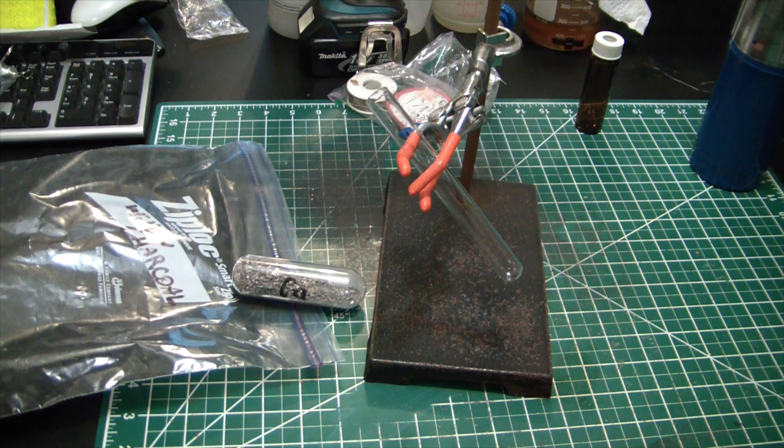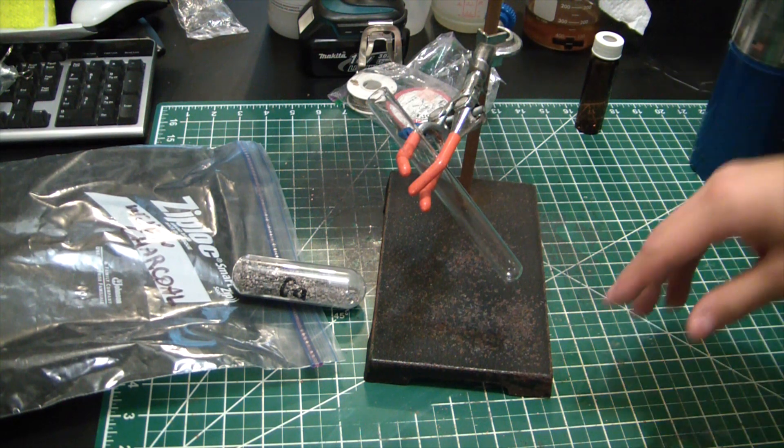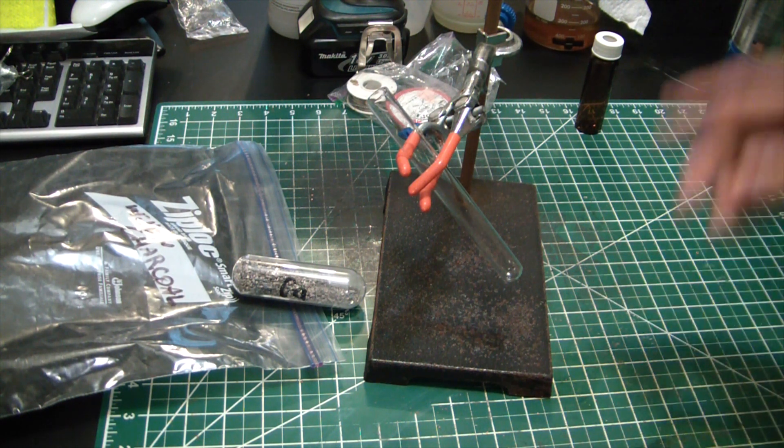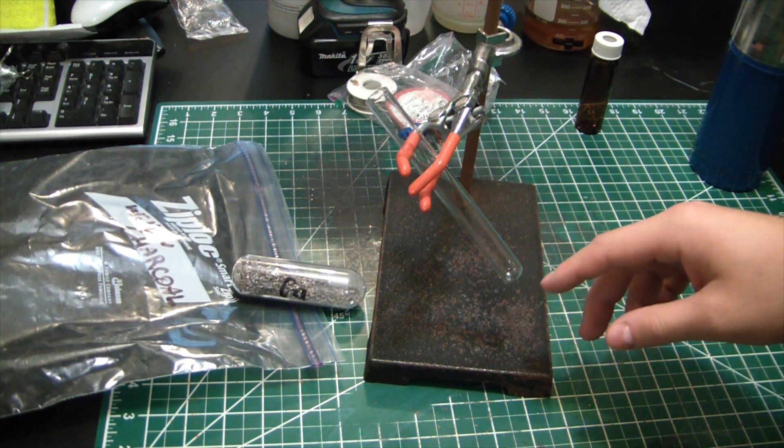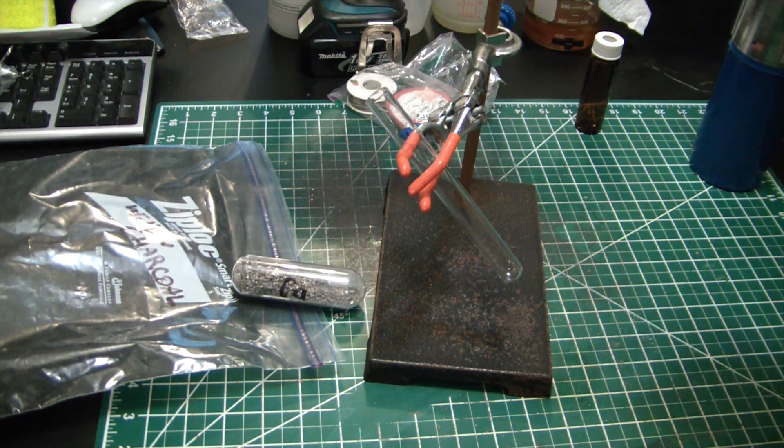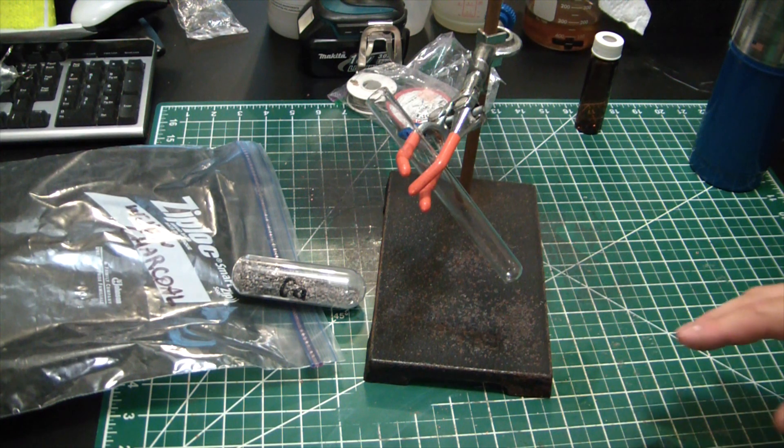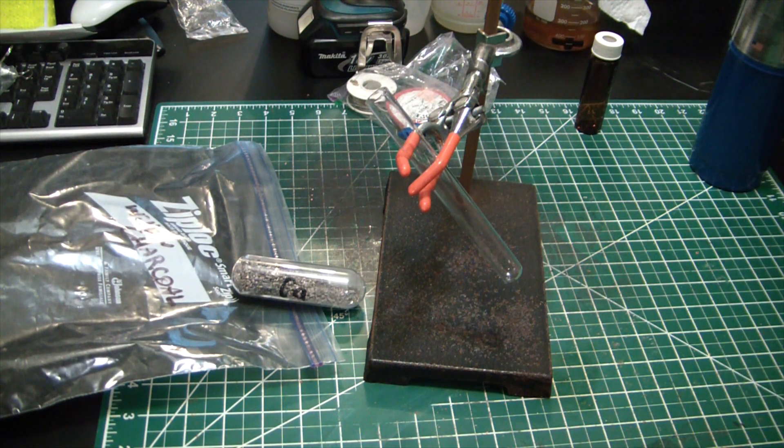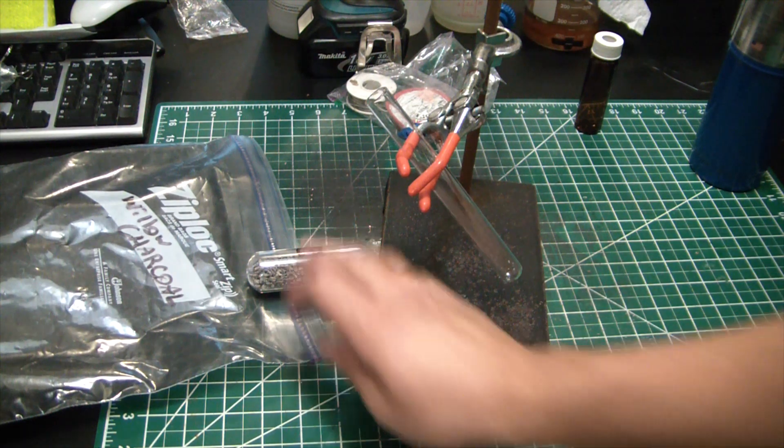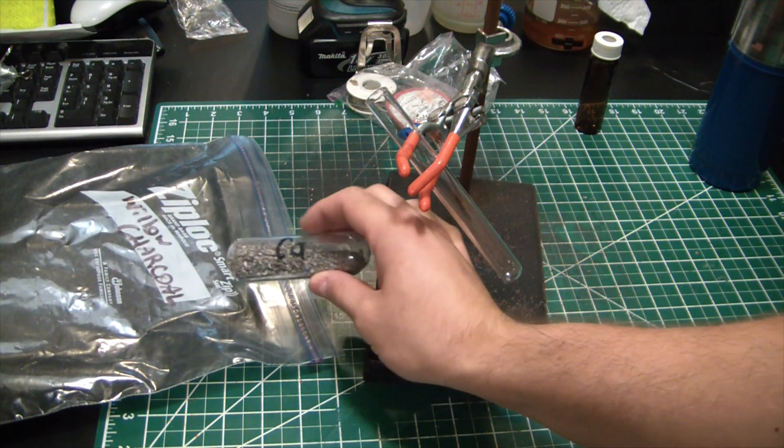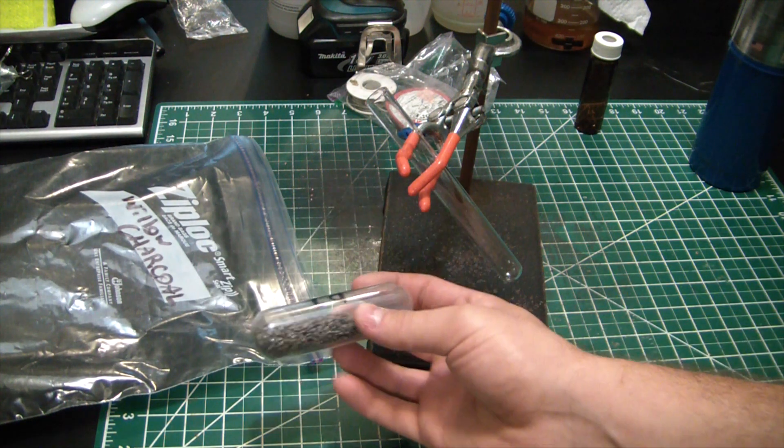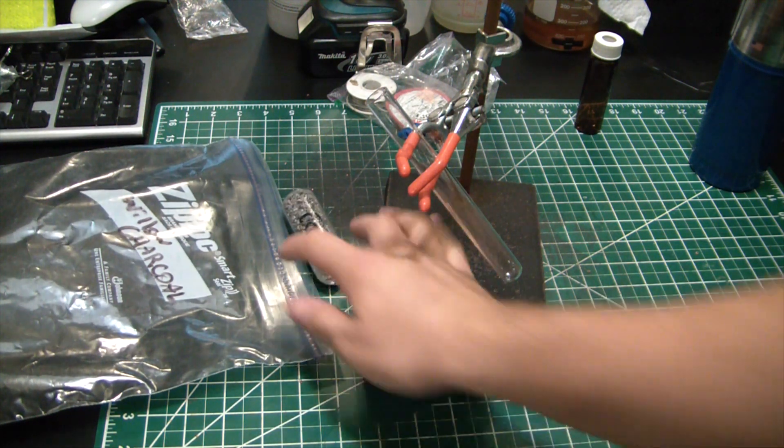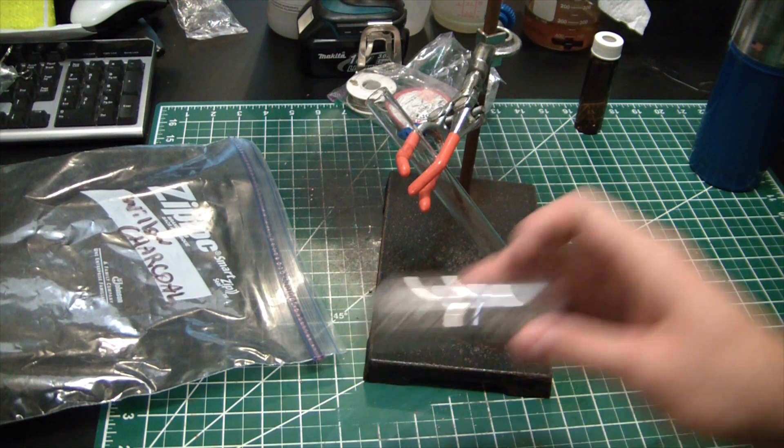In the words of Nerd Rage, we're exploring the science. This is totally non-economical and doesn't make sense to do it this way, but I just want to see if I can do it. What I have is some calcium in an argon vial that I got on eBay.